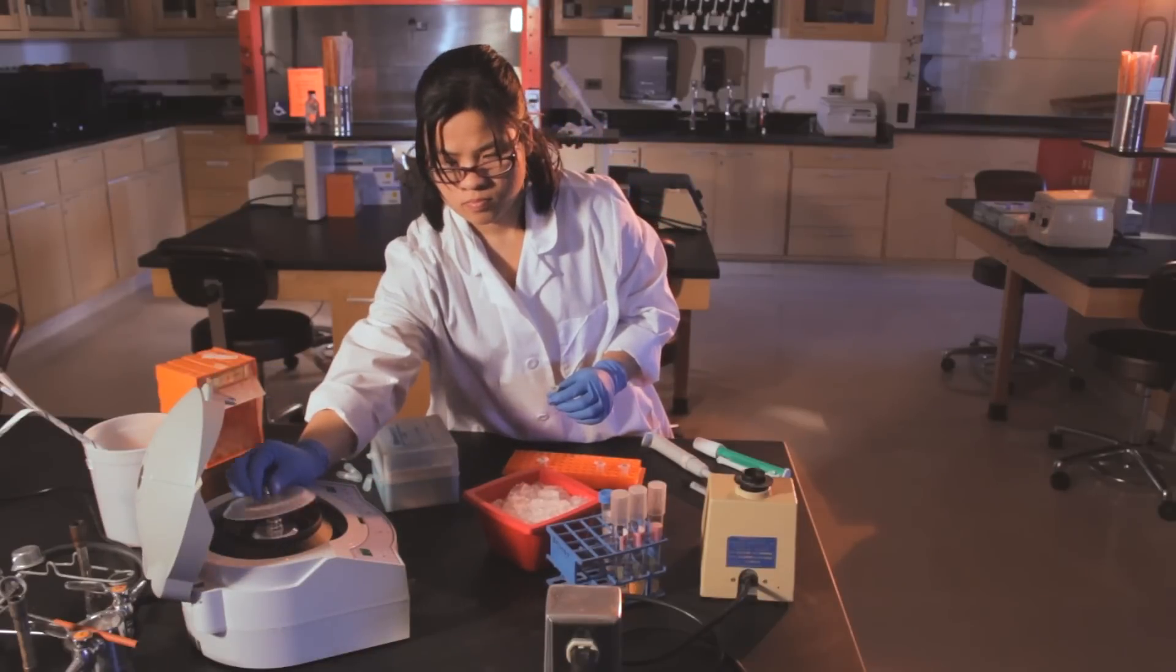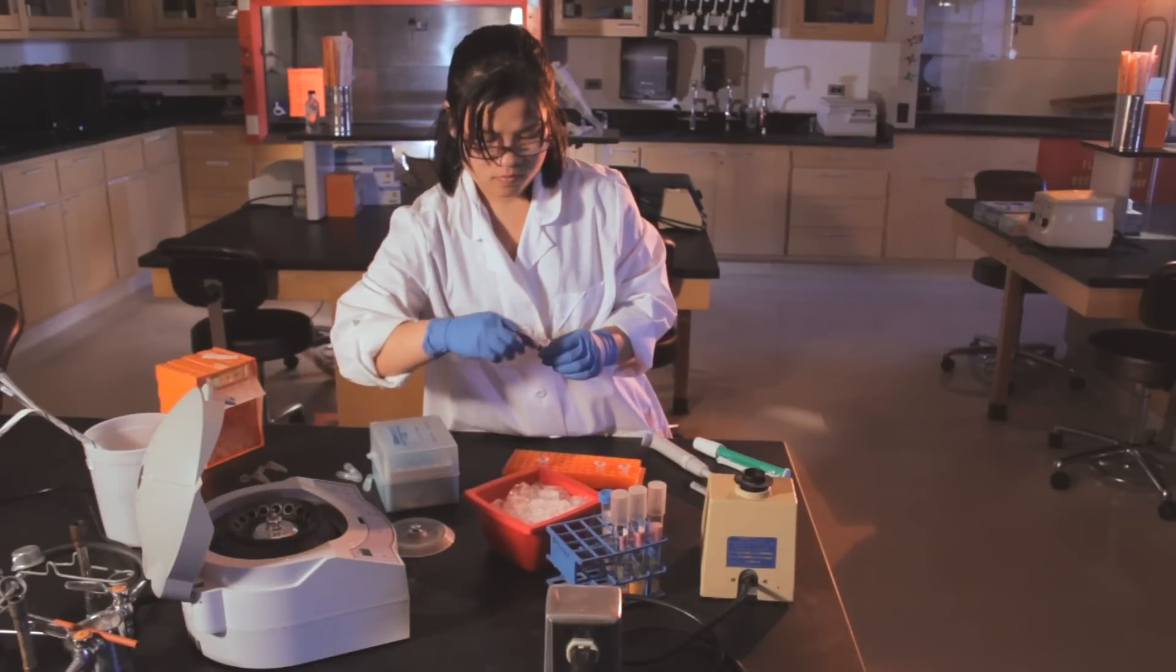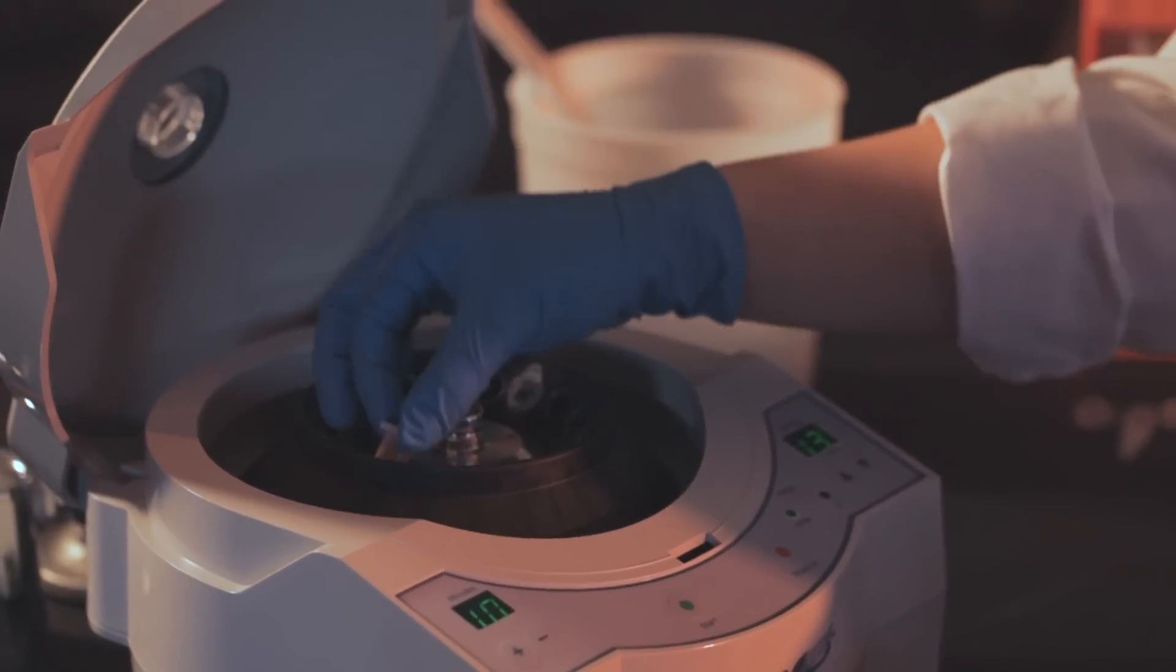Now close the tubes and centrifuge them for 10 minutes at full speed. Remember to balance your centrifuge!